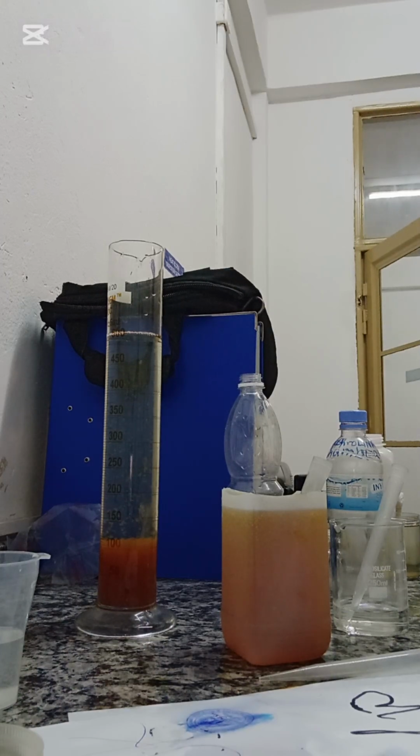And you get a much clearer water sample. The chemical oxygen demand also tremendously changes as a result of separating, as a result of flocculation and coagulation. So the best way before filtration, in order not to overwhelm the filter, is to do flocculation. So for this part, I've used ferric chloride.